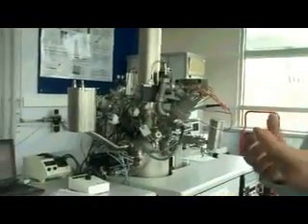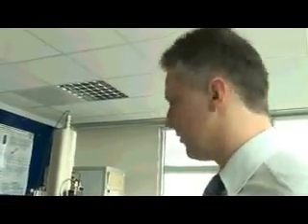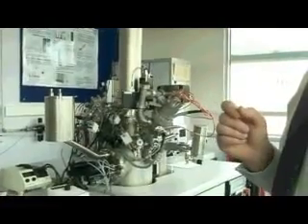Hello. So this is basically what we call a mass spectrometer, but the essential tool we use to find out what a substance is made of chemically. So when someone designs, say, a new nanoparticle, something to deliver a drug, one of the critical questions is what's the material on the surface and how it's going to interact with the body, and this is the tool we use to find out what that material is made of.